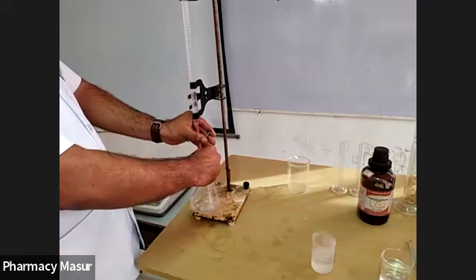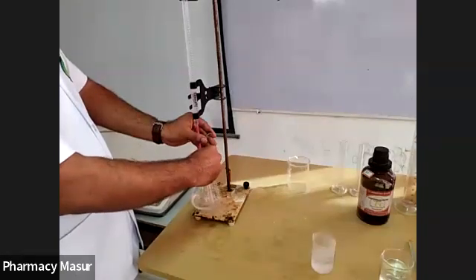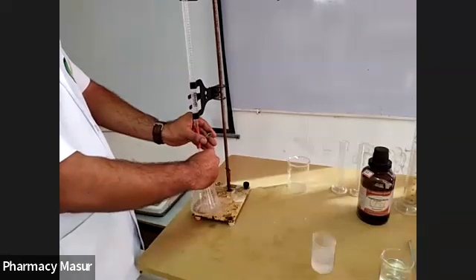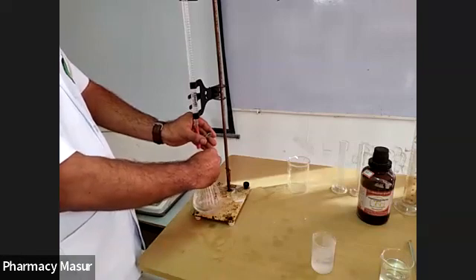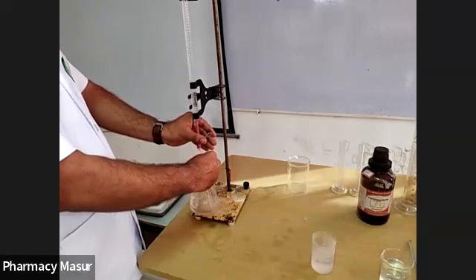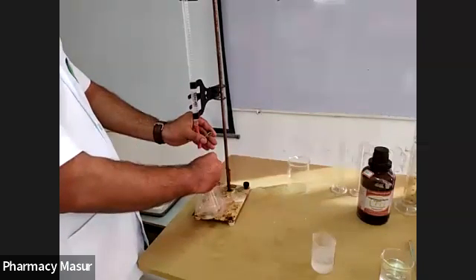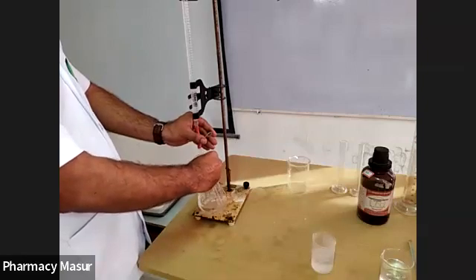After each drop, you have to stir the solution — just add a single drop at a time. We want to continue this process until a color change occurs, that means from colorless to a color change. When we get a pink or just slightly pink solution, that is our endpoint.